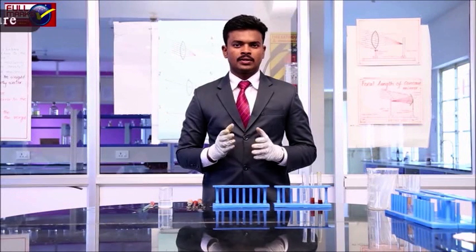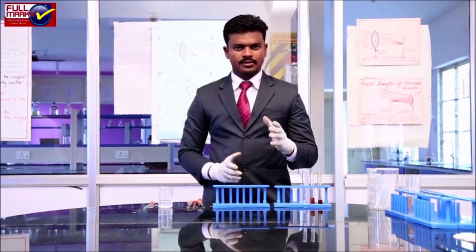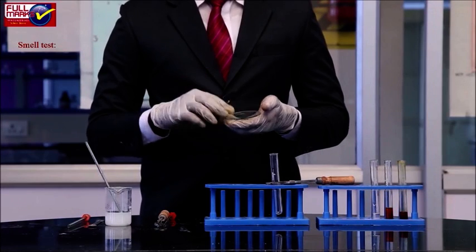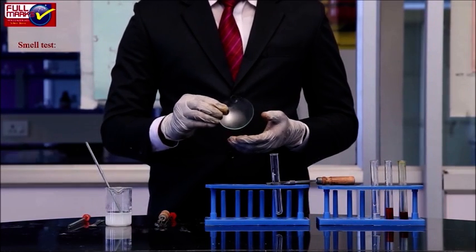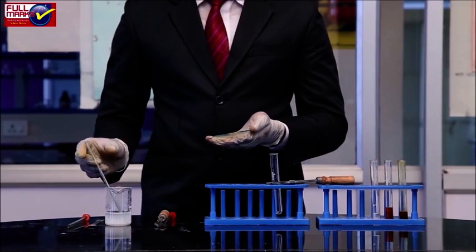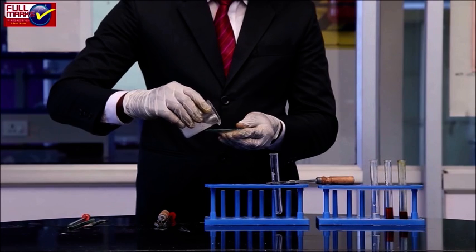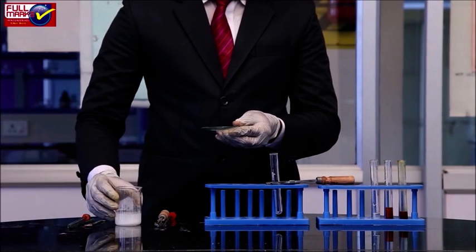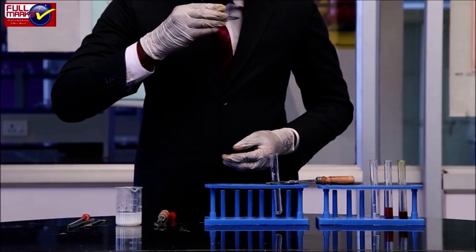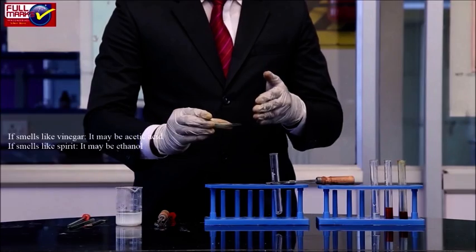Procedure and observation. There are different functional groups that are present in organic compounds. Each functional group undergoes a characteristic reaction which helps us to identify that functional group. Smell test. Take a small amount of organic liquid or solution of organic compound in a watch glass and smell it by wafting. If it smells like vinegar, it may be acetic acid, and if it smells like spirit, it may be ethanol.